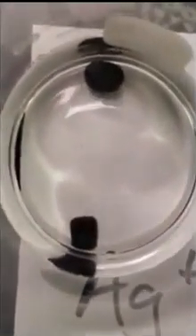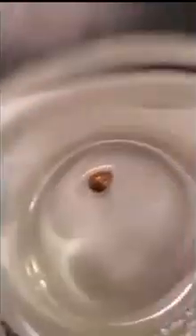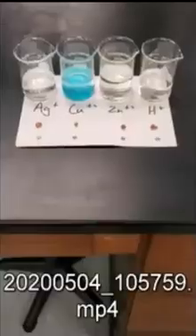I don't know if you can tell, but if you look closely, there's some bubbles forming on the zinc, and it looks like nothing's happened with the copper. Definitely a change there. Definitely a change there to the zinc. Doesn't look like anything has happened to copper there, nor there, but the zinc has changed.